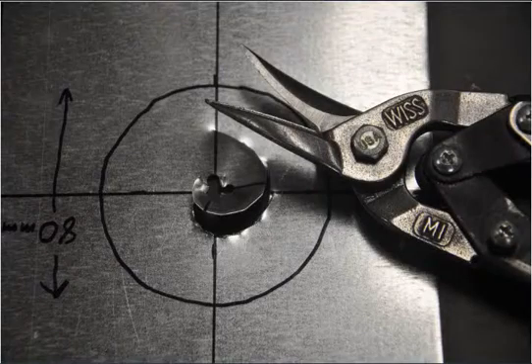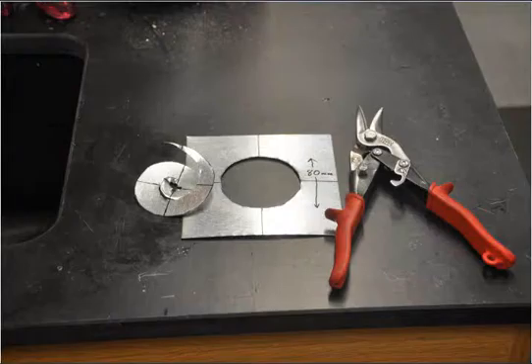And then we're going to begin to cut the circle. We're not going to cut out to the circle edge and then try to cut the circle at a 90 degree angle. We're going to start at the center and kind of spiral our way out to the edge of the circle, and we end up cutting it fairly well. You can get a fairly consistent cut with a pair of tin snips. With a little practice, you get a little better.